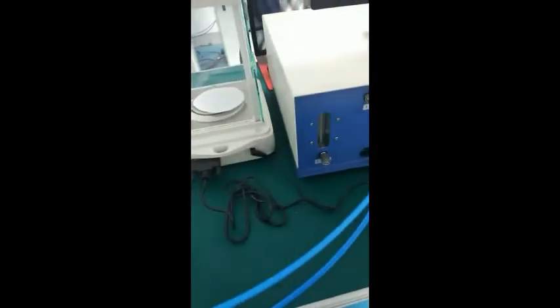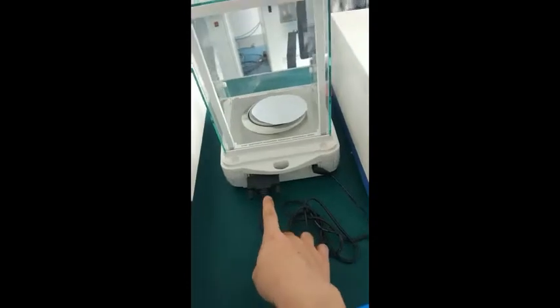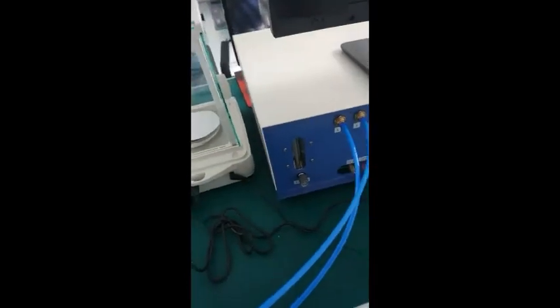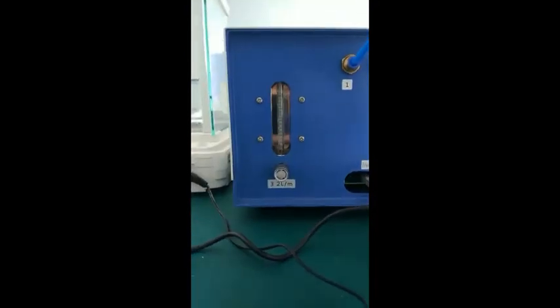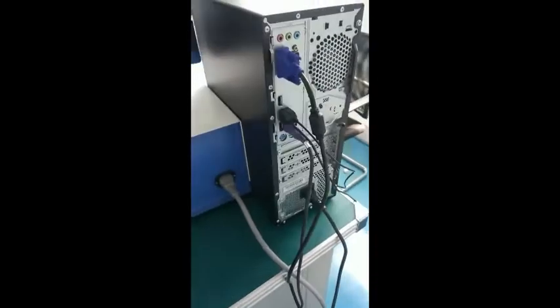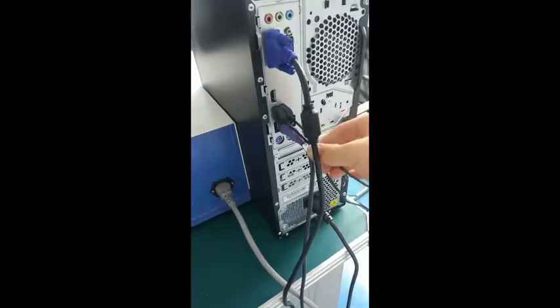Next, the line above the balance is connected to the main board of the analyzer. This is the power line of the balance. The flow meter is 3.2. The computer can be connected as usual.